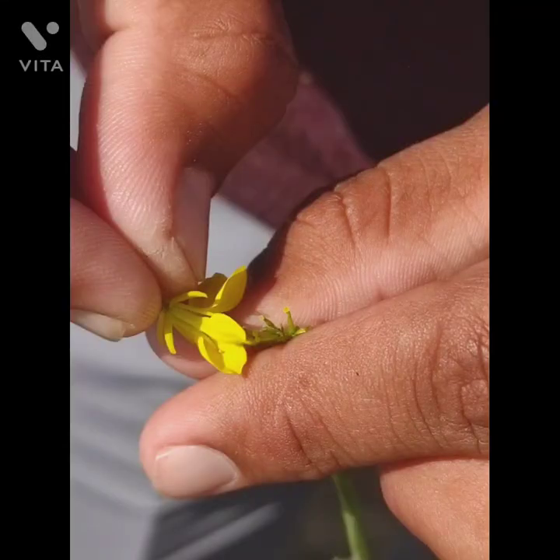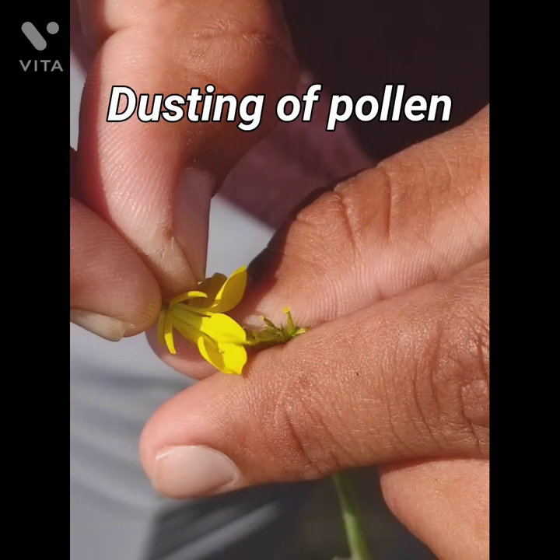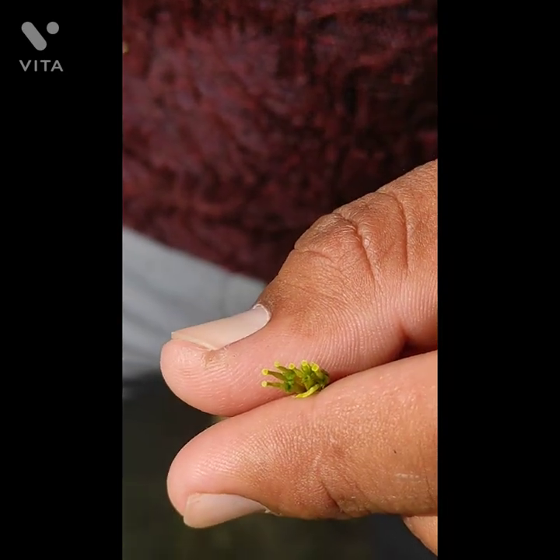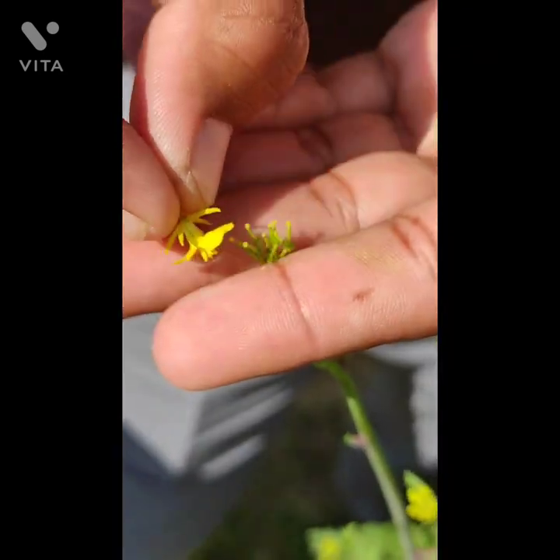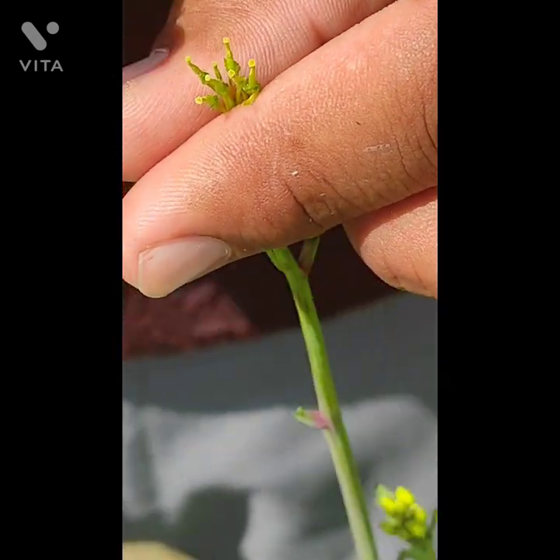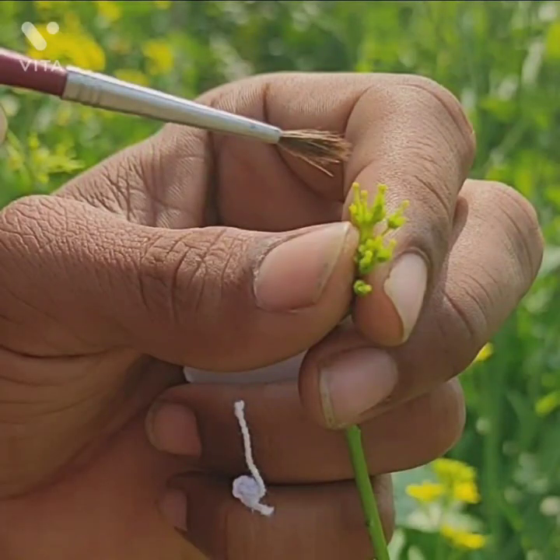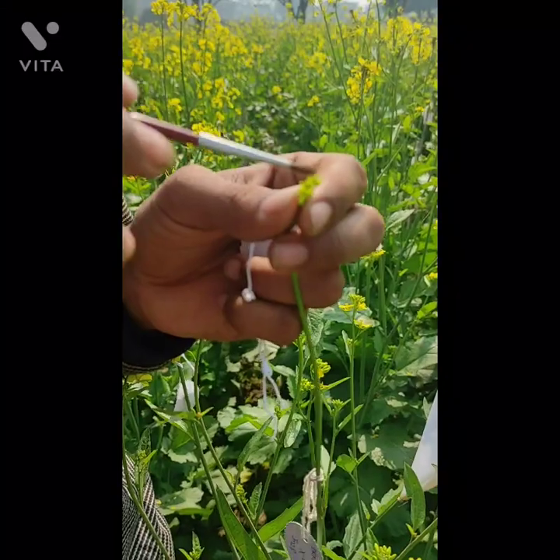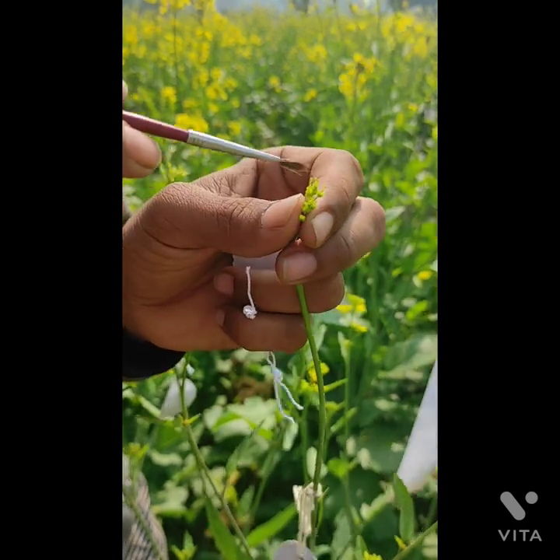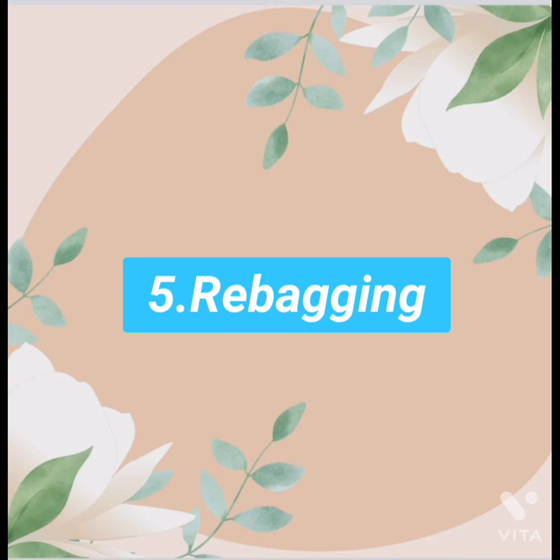Now let's see the process of dusting of pollen. Remove the butter paper of the emasculated plant and dust the pollen on the stigmatic surface of the emasculated plant. Hold the emasculated buds between the fingers and then lightly move the flower of the male plant to and fro. Dusting of pollen can also be done with a brush — this is dusting of pollen with a brush on the stigmatic surface of the emasculated plant.